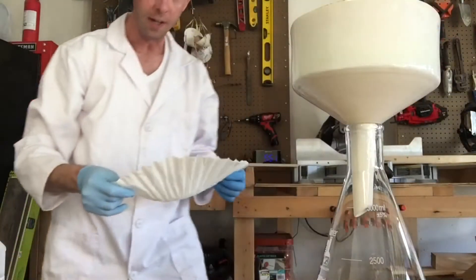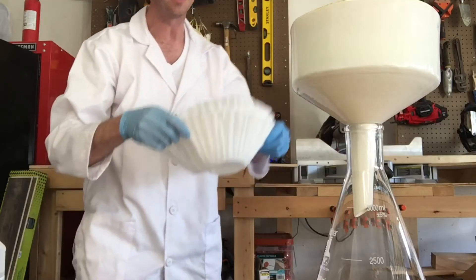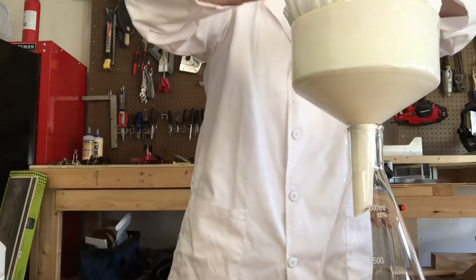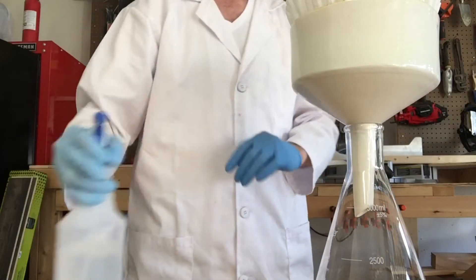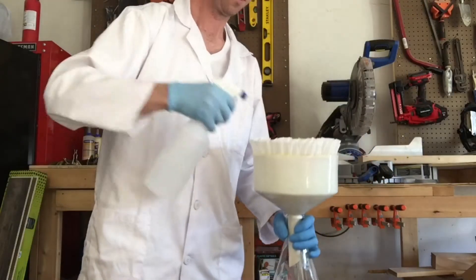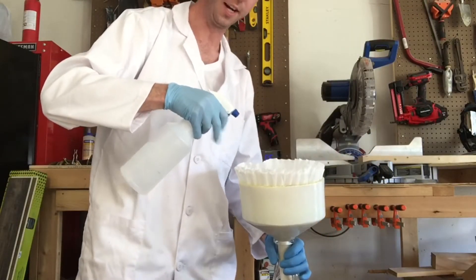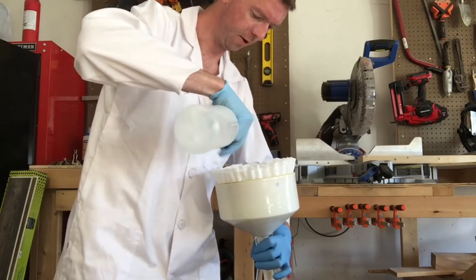What I'm going to do here is I got these really large coffee filters and I'm going to put two of them into the Buchner funnel. We're going to get it good and wet just so it forms through the actual funnel itself.